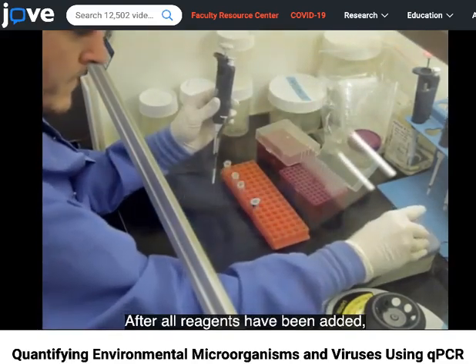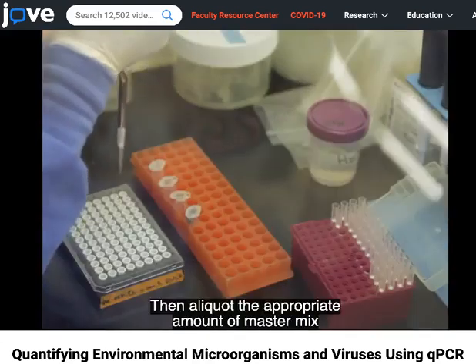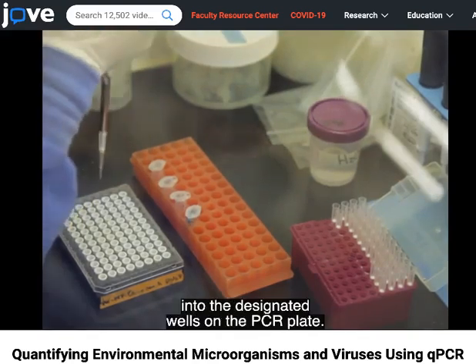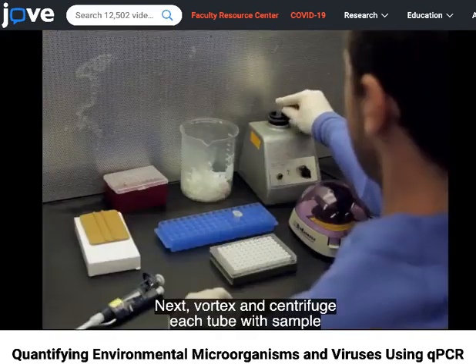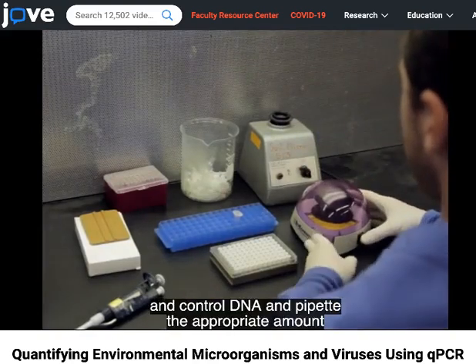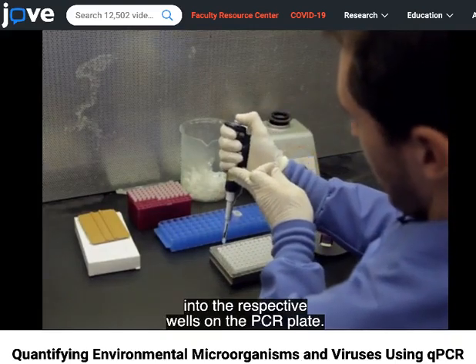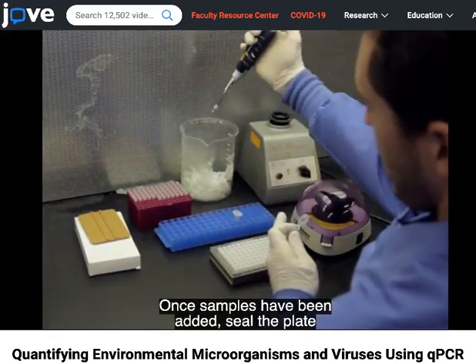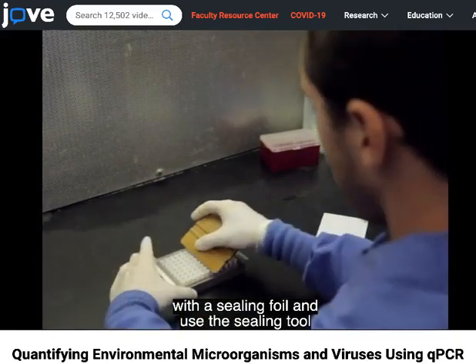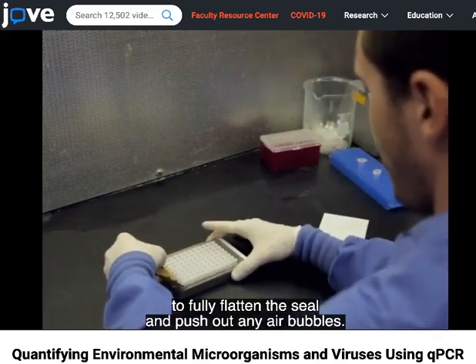After all reagents have been added, vortex to mix and centrifuge. Then, aliquot the appropriate amount of master mix into the designated wells on the PCR plate. Next, vortex and centrifuge each tube with sample and control DNA, and pipette the appropriate amount into the respective wells on the PCR plate. Once samples have been added, seal the plate with a sealing foil, and use the sealing tool to fully flatten the seal and push out any air bubbles.